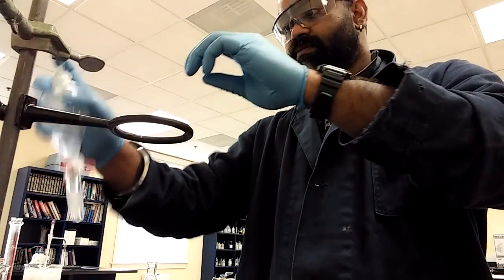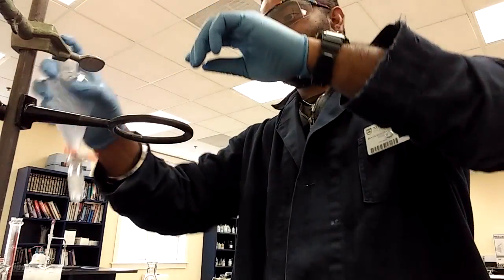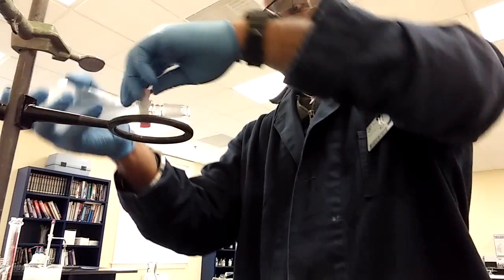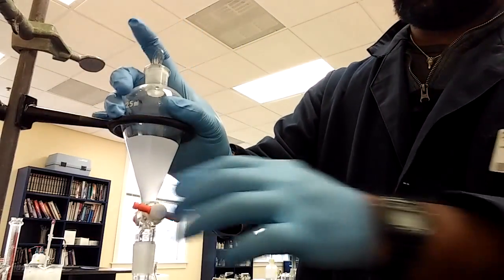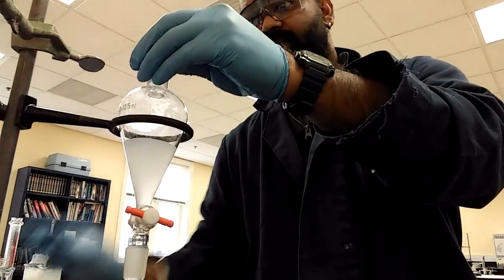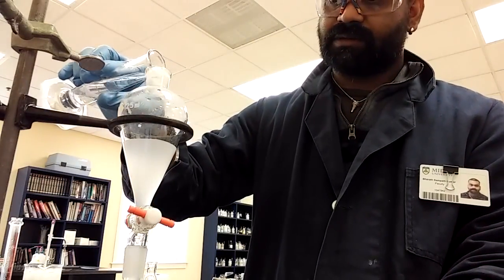So face it away from you or your lab partner. You don't want to be on their face. Okay, that's good. I'll probably go a little vigorous when I'm all set and done, but that is good enough. You're shaking it. Add a little bit more.